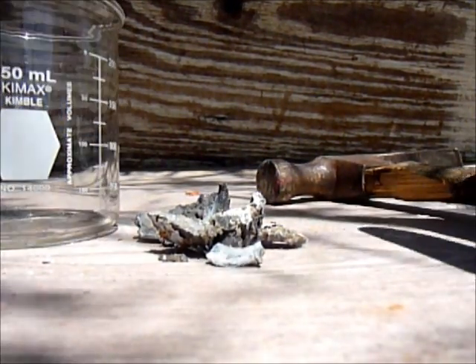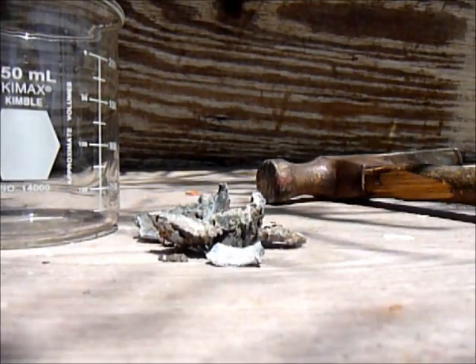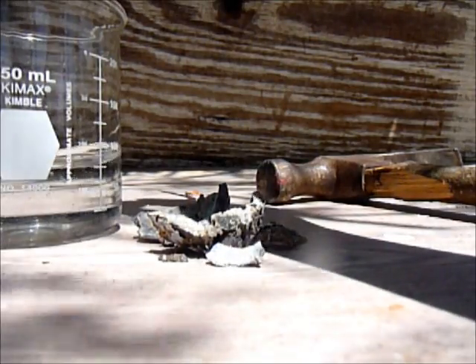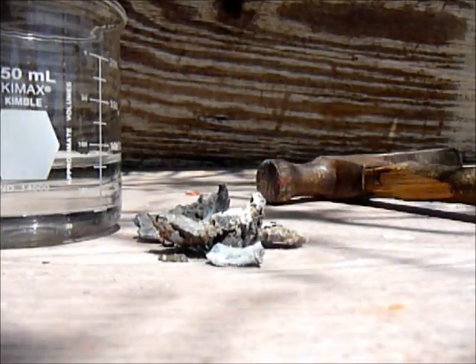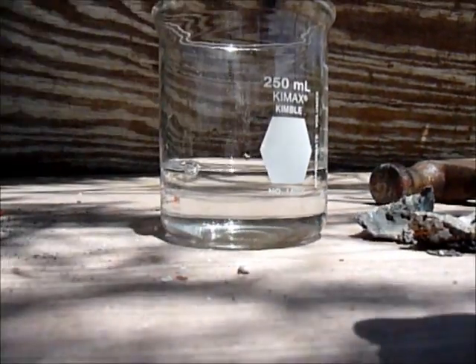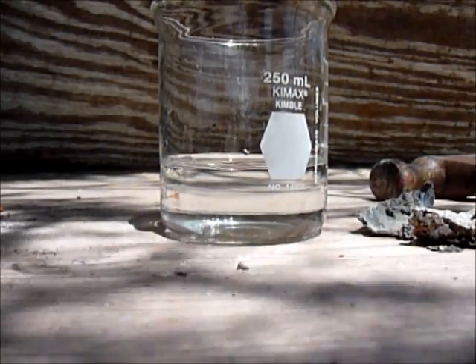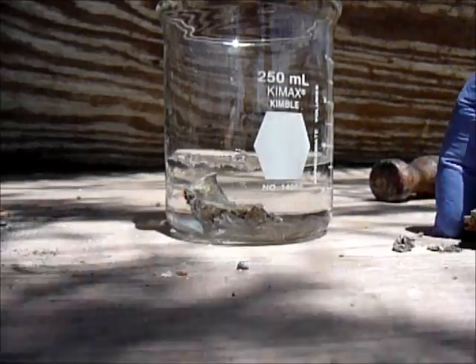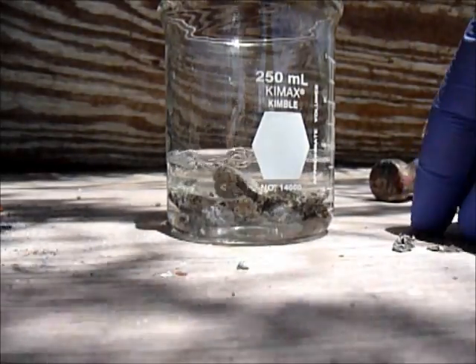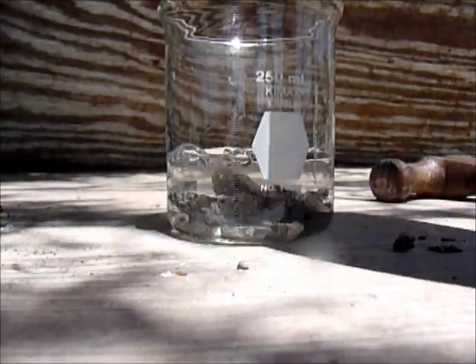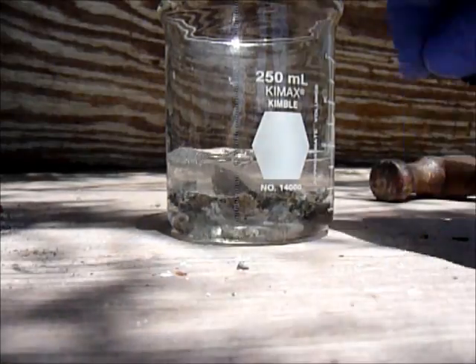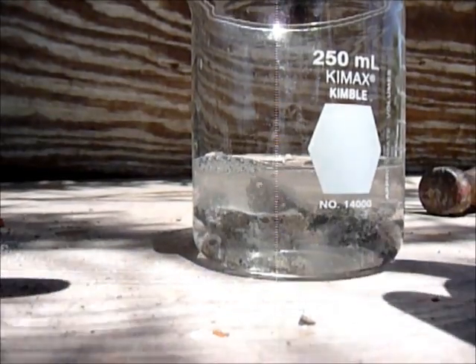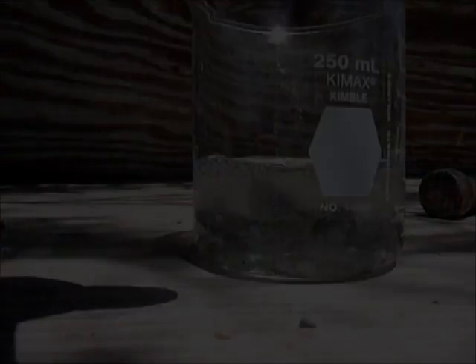I'll get a beaker and pour in about 100 milliliters, and then add all the stuff inside here. It should react with it. I don't know why it reacts, but it reacts. That's why you can see it all bubbling. I'll show you when it's finished bubbling.